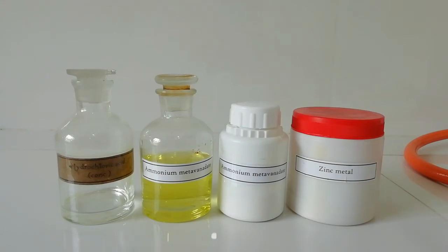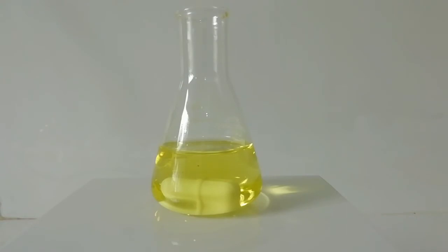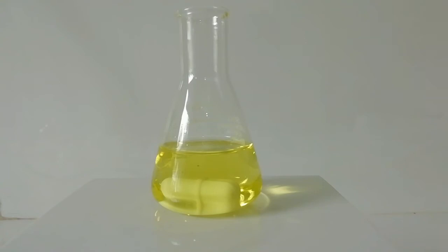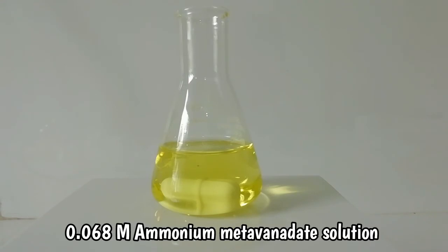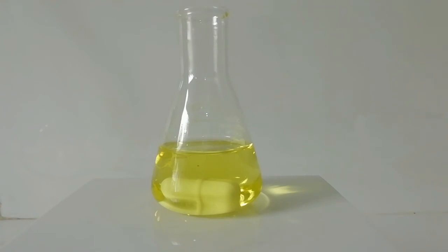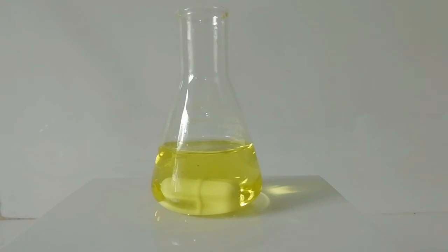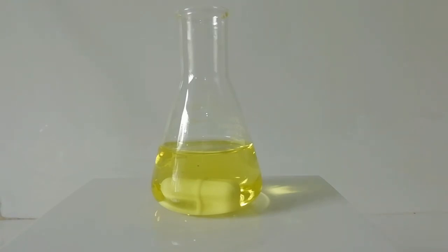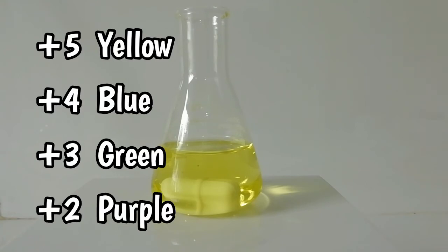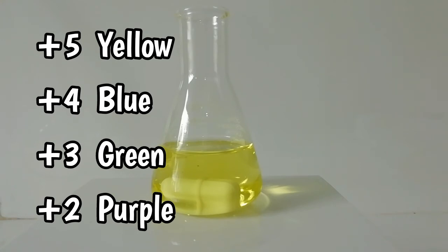Now you can see the ammonium meta vanadate solution — I have taken about 30 milliliters and it is yellow in color due to the plus 5 oxidation state. I am going to add zinc metal, which reacts with the hydrochloric acid in the solution and provides electrons. Those electrons help reduce the vanadium from plus 5 down to plus 2. We have four oxidation states: plus 5, plus 4, plus 3, and plus 2, with colors yellow, blue, green, and purple respectively.